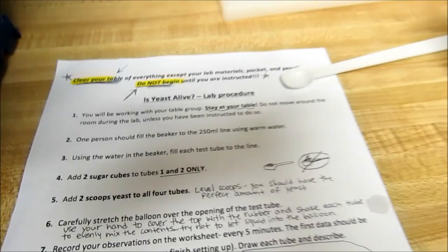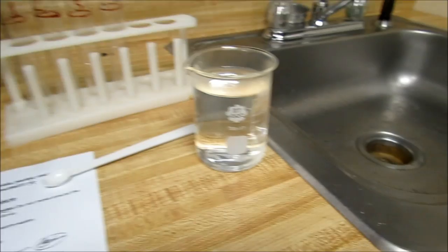Alright, this is the Is Yeast Alive lab. First thing I'm going to do here, I've got my four test tubes all set up.